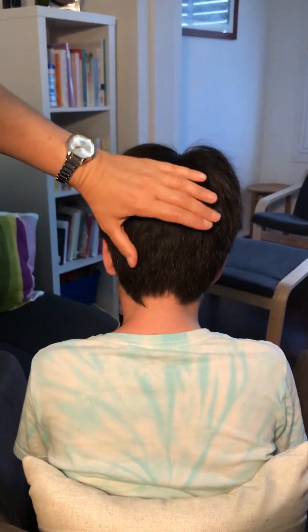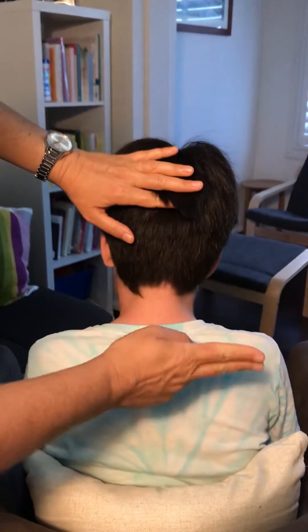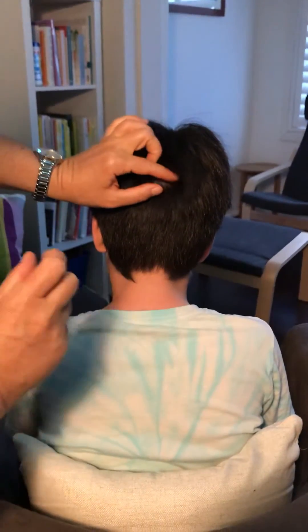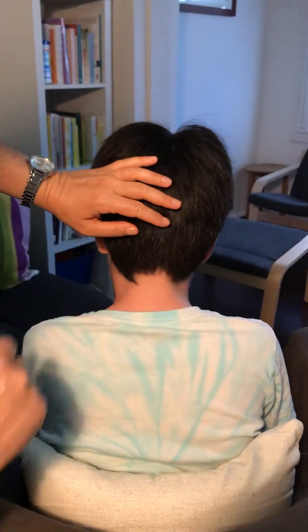If your hair is much longer than this, you need to cut the rest of the length off. You'll only be keeping about an inch of hair from the scalp — the rest gets cut off.